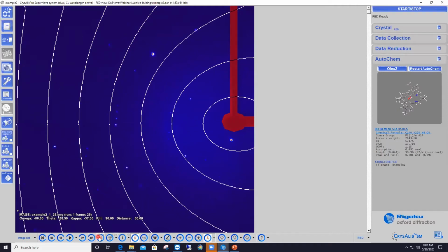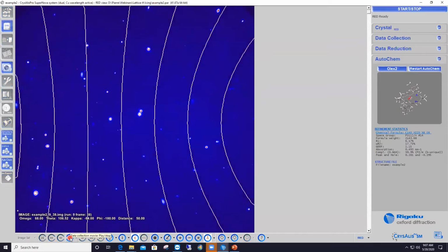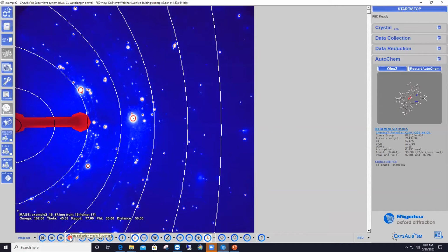And again, the next button over makes me jump to the first image of the next run. So here I'm showing frame number 1 of run number 2. If I click once more, now frame number 1 of run number 3, and so on and so forth. These three buttons are for forward motion. The equivalent three buttons on the left-hand side are for backward motion. And the button in the middle allows me to play the dataset as a movie, which is what I'm doing right now. I hope that through Zoom, you can see what was going on.